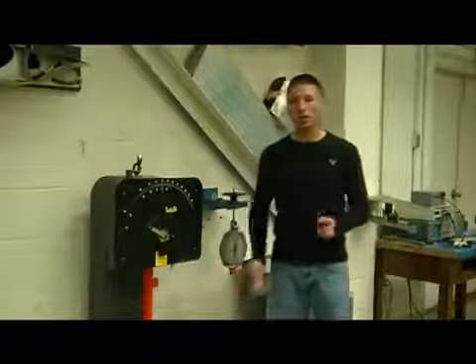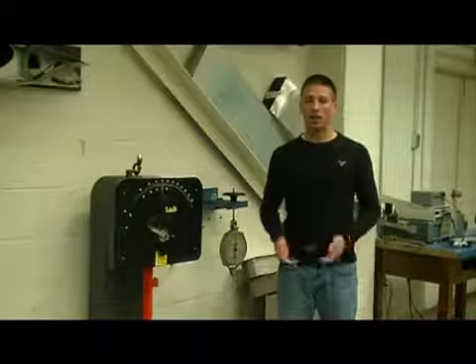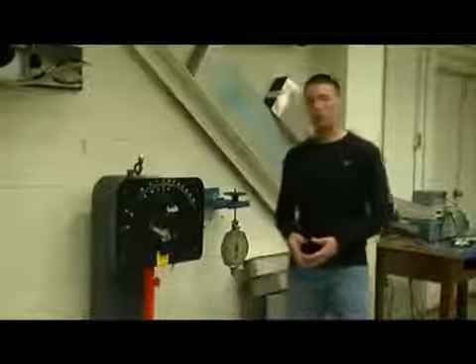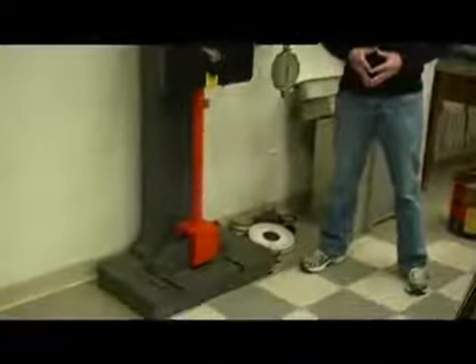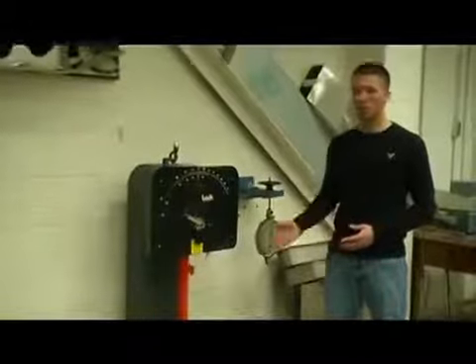The Izod machine is unique for two reasons. One, the geometry in which it supports the material is a cantilever beam, as opposed to the Charpy's simply supported beam. Also, the weight of the hammer is 30 pounds. So again, the hammer is held from a height of 2 feet. This results in a potential energy of 2 feet times 30 pounds, 60 foot-pounds. This doubles the potential energy capable in this machine.